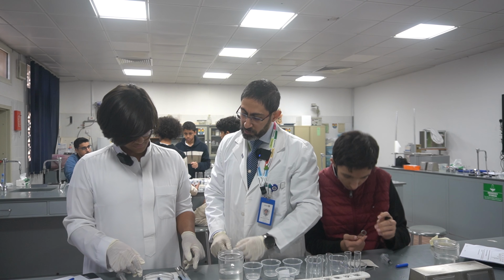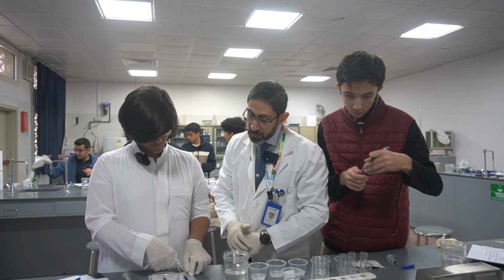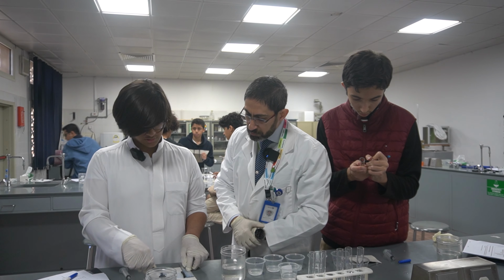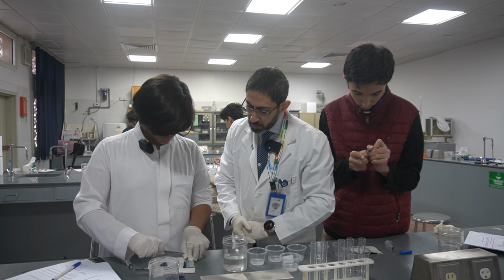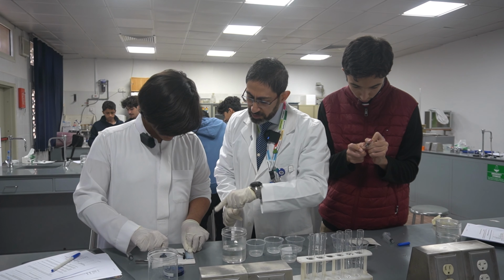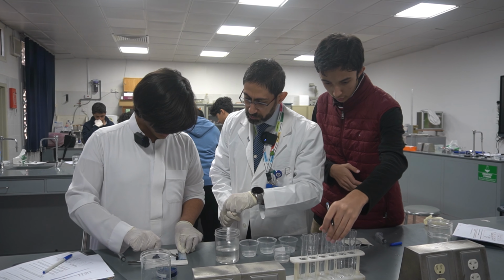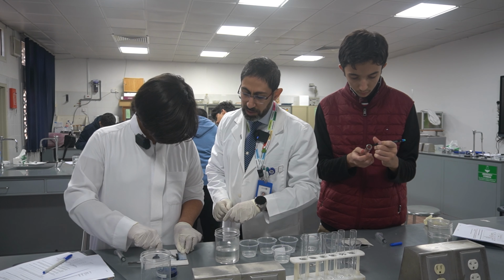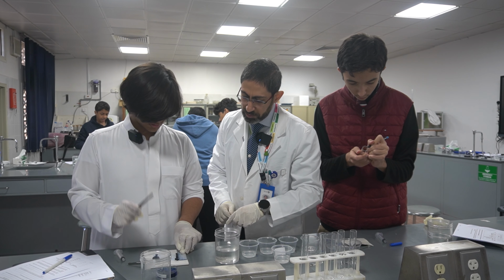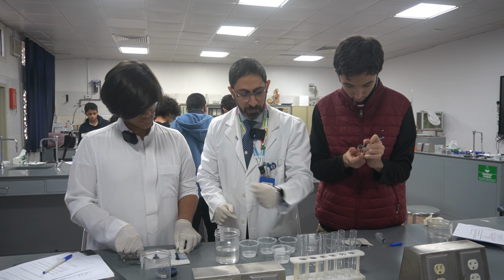Okay, Abdul Majid, what are you doing here? So I would basically take the ruler and the potato slices, and I would cut it exactly at 1 centimeter. The length is 1 centimeter? Yes. And the width? 0.75. So you would cut it like this. How many pieces will you cut? We need 6. That's great.